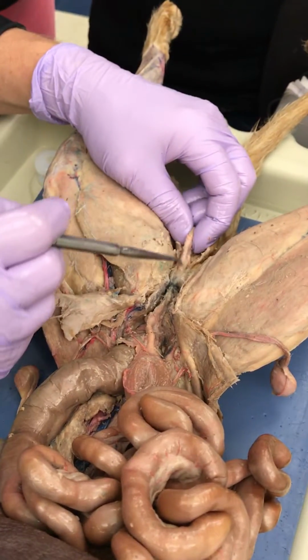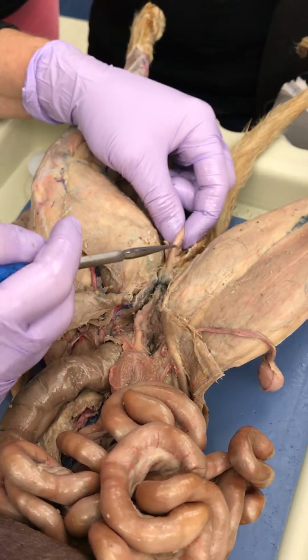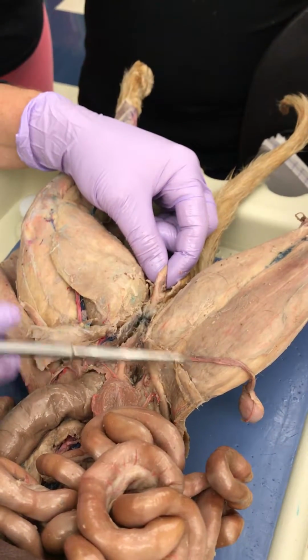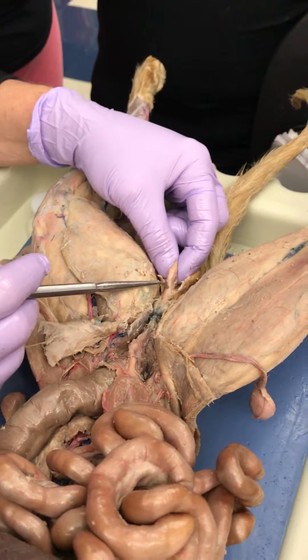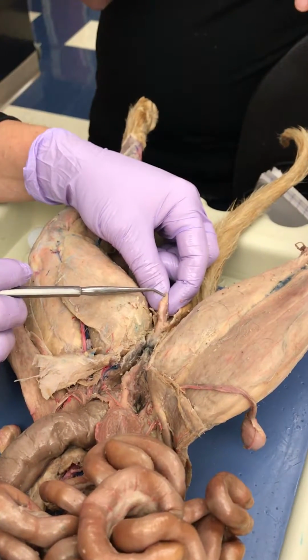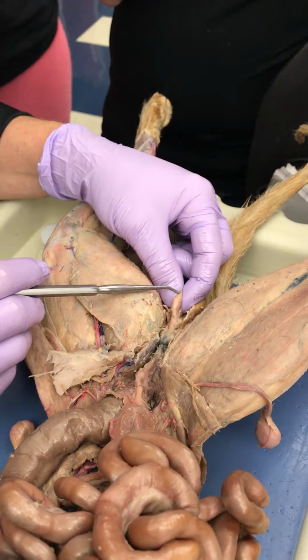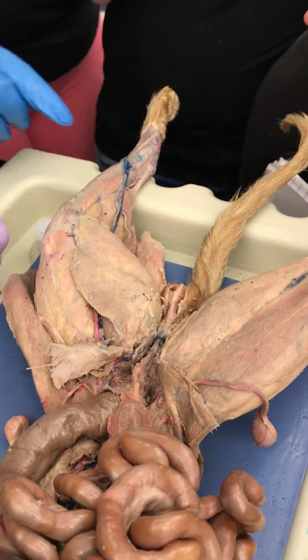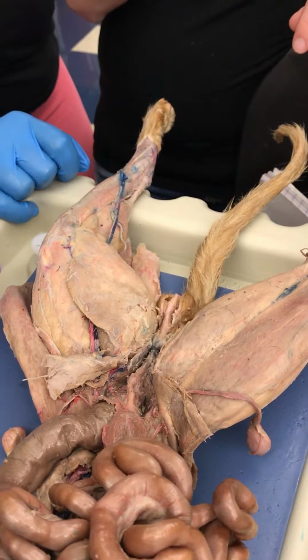Okay, what's the name of this? Are you talking about the covering or the penis itself? Penis. So you're just going to write penis. Shaft of penis. And then if I pin here, glans of penis. Shaft of penis. Glans of penis. Don't get your penile parts messed up.